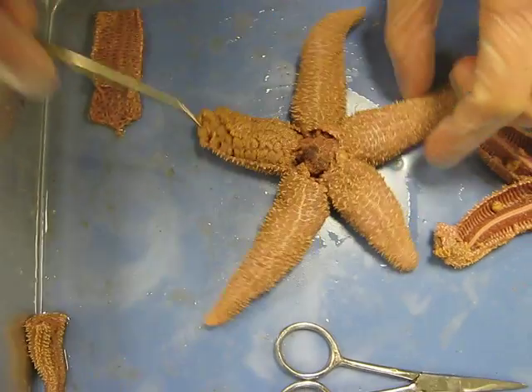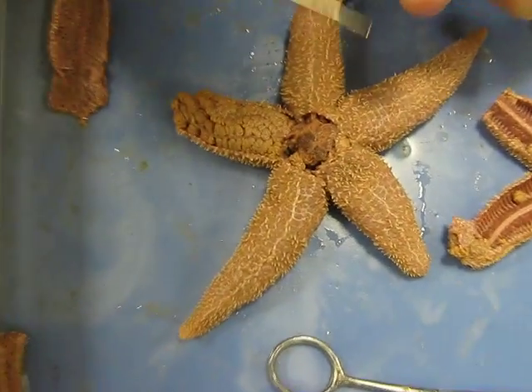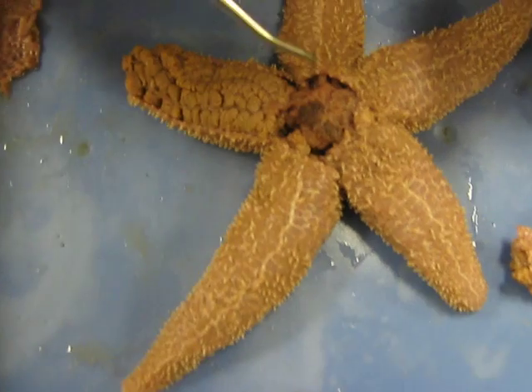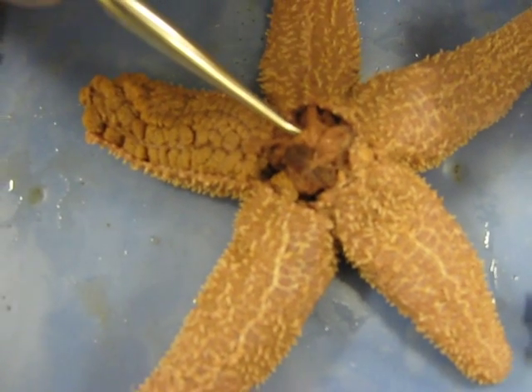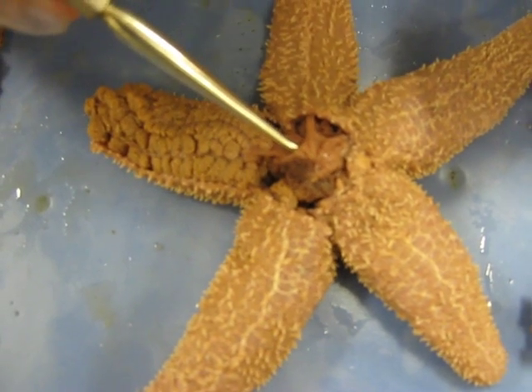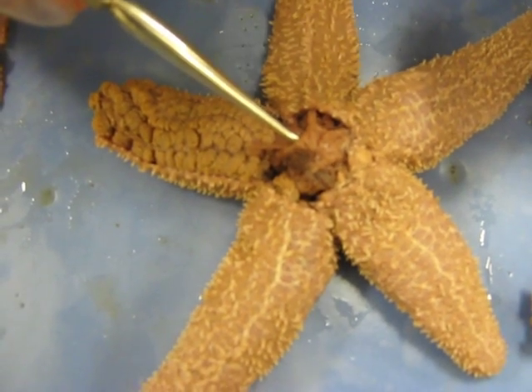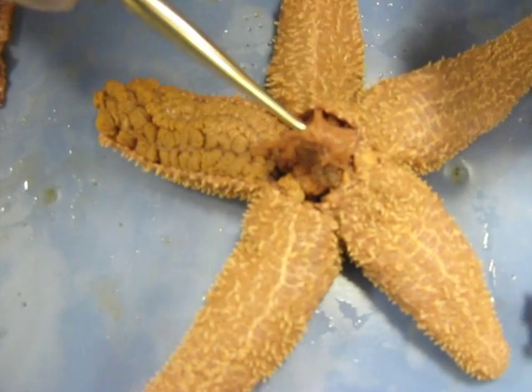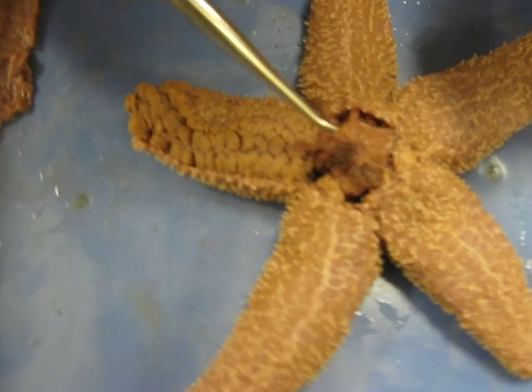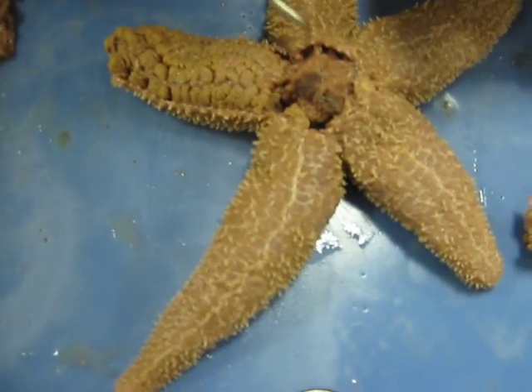And then it's cut open right here so you can see the internal anatomy. This chamber right here that sticks out on top is called the pyloric chamber of the stomach — the pyloric stomach. And underneath that, under here, is the cardiac chamber of the stomach.